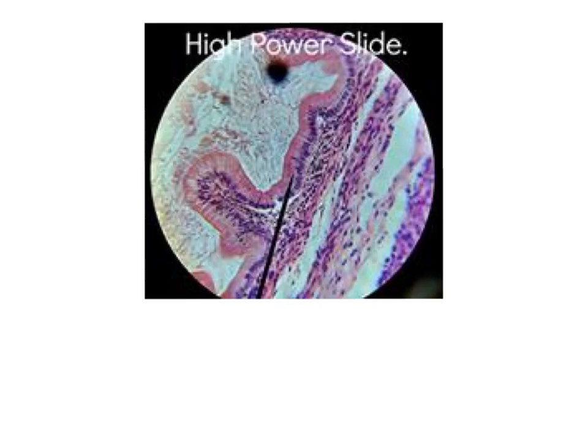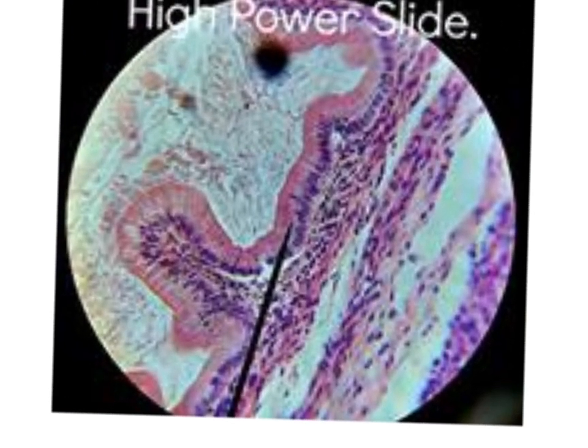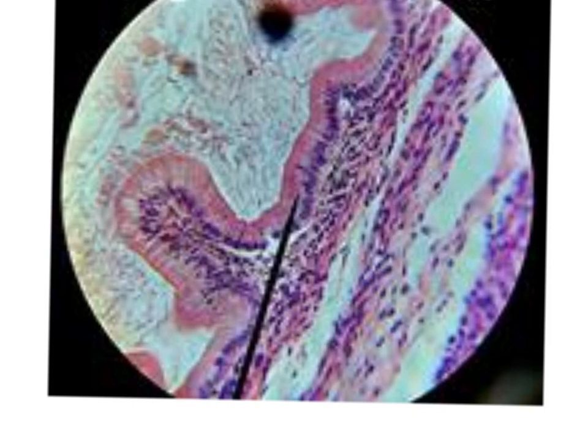This is another type of epithelium, which is the simple columnar epithelium. In the simple columnar epithelium, you can know it by the shape and the position of the nuclei. The nuclei are oval in shape, and they are resting on the membrane, no space in between the nucleus and the base membrane, and the cell is tall here, evident by the red color of the cytoplasm.